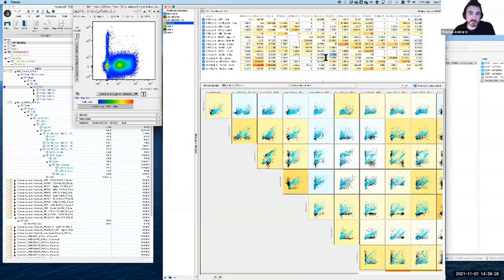Now, the value is much the same as we talked about before. The actual value here, in case you can't read it, is 0.0781. So it's a very low compensation value. So it's effectively 0. Just to give you an idea of what happens here, if I set this to 0, I mean, it's probably not going to move very much, but it might move a tiny bit. Yeah, it's pretty much no movement.